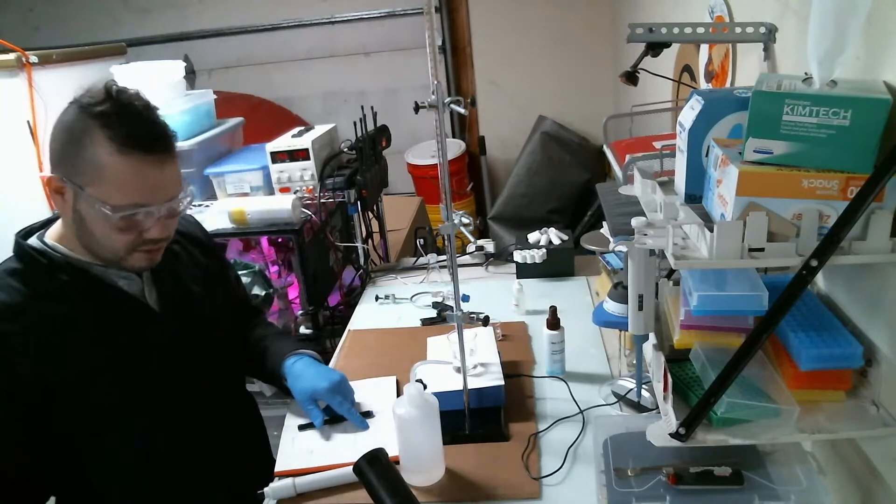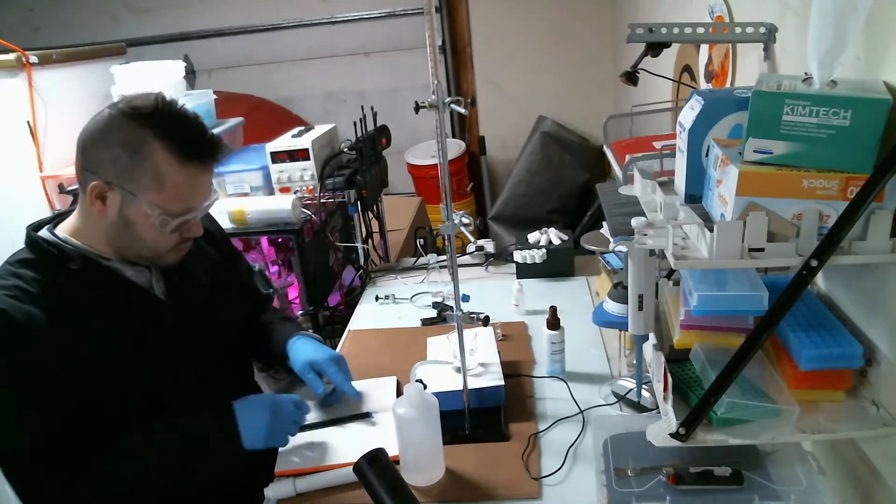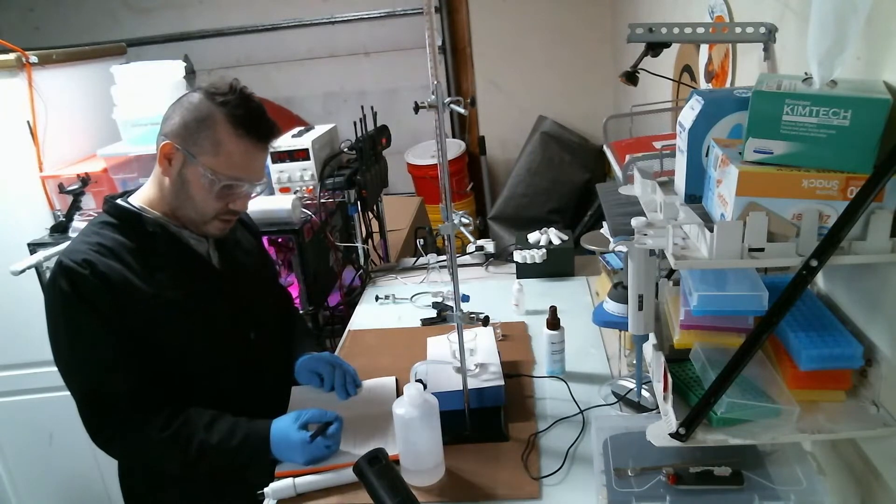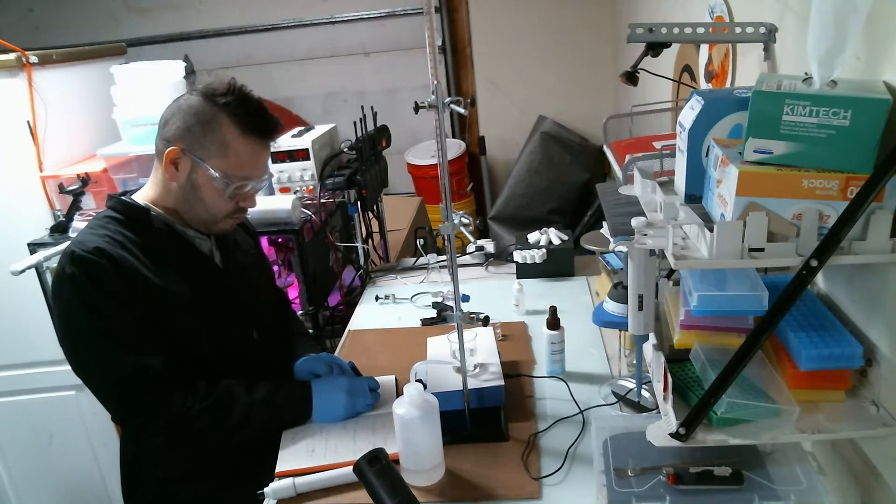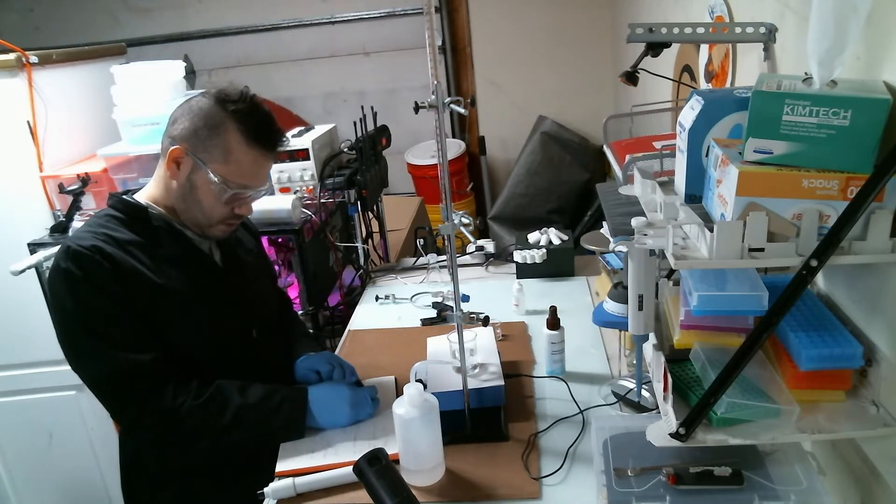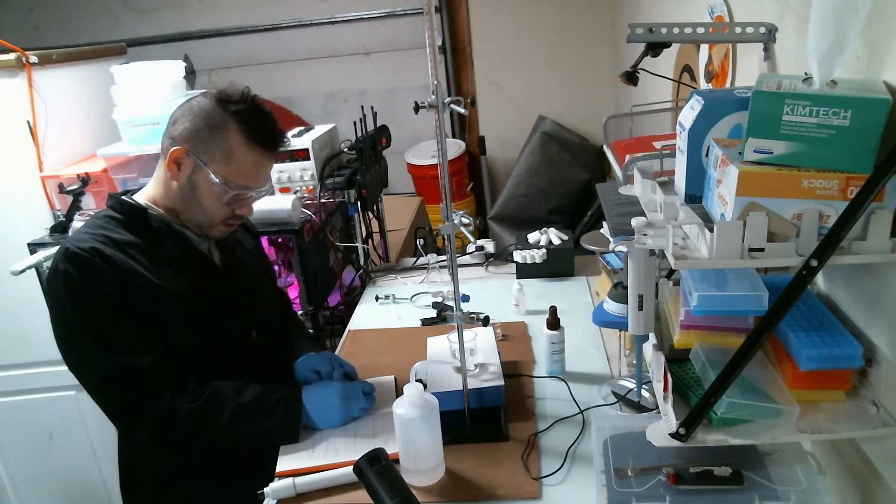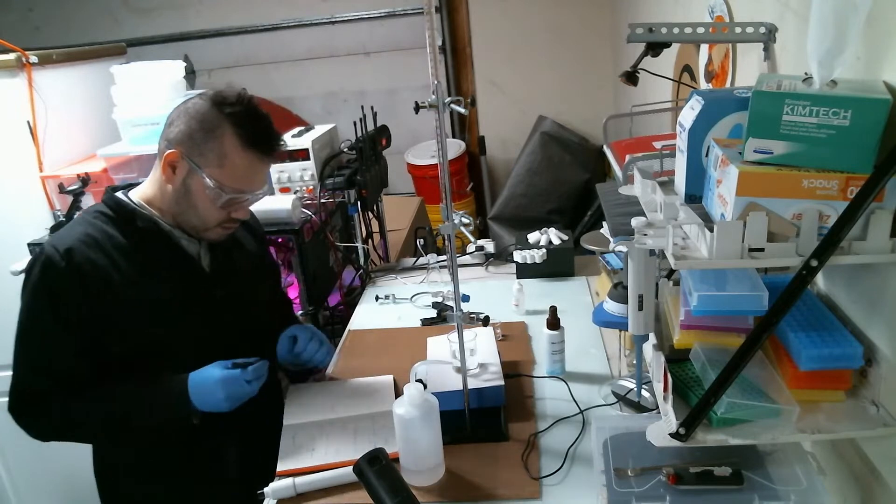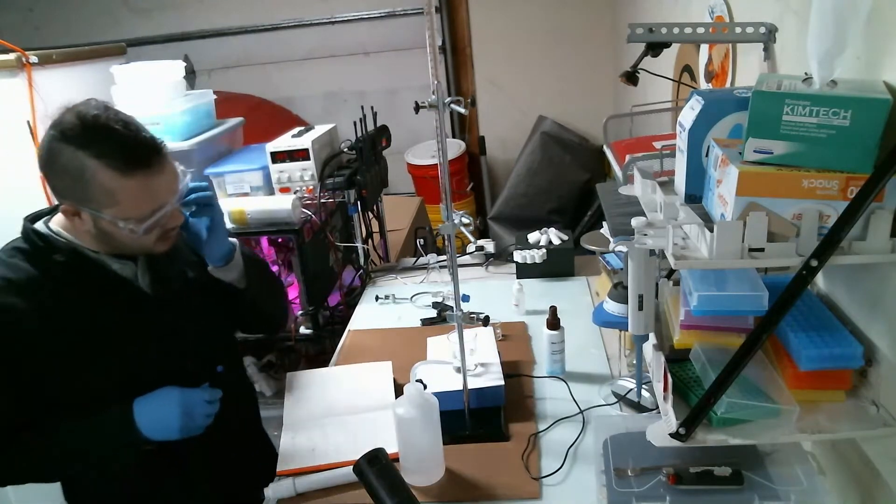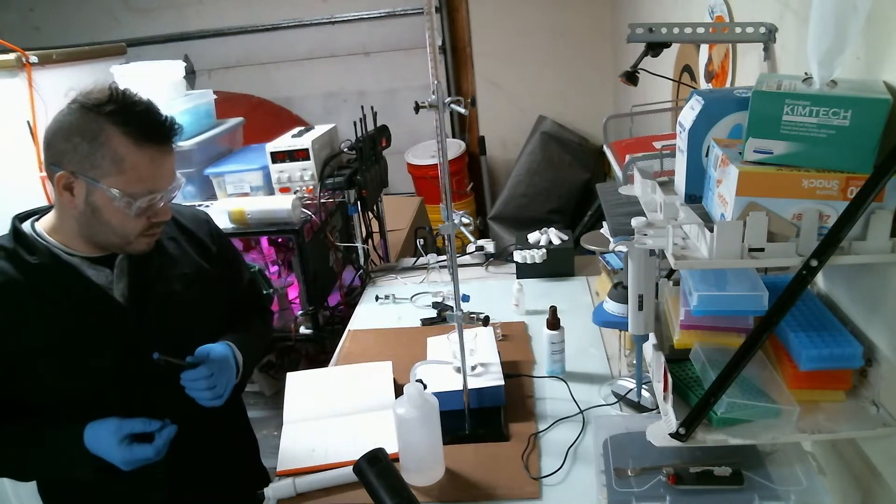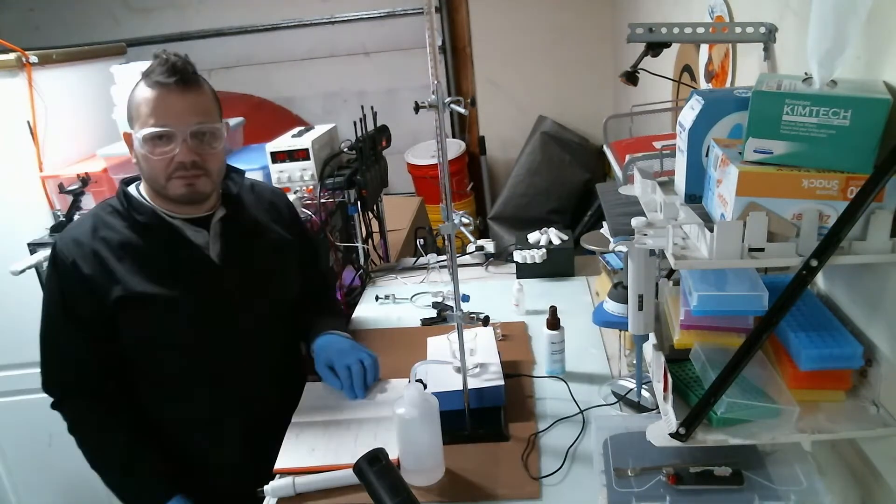Essentially, let's see here - the molar mass of sodium hypochlorite is 74.44. So 1.35 moles times 74.44 is about 100 grams of sodium hypochlorite per liter.